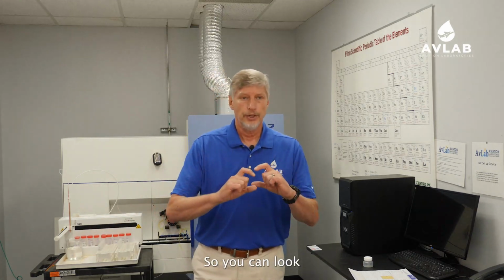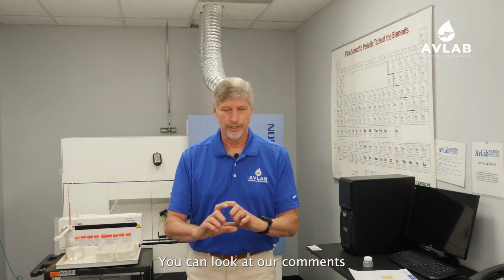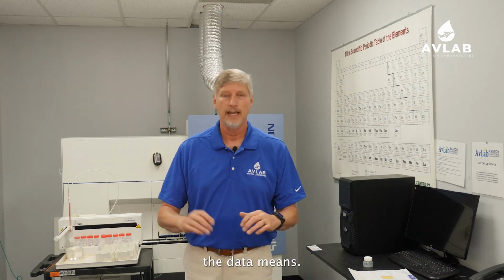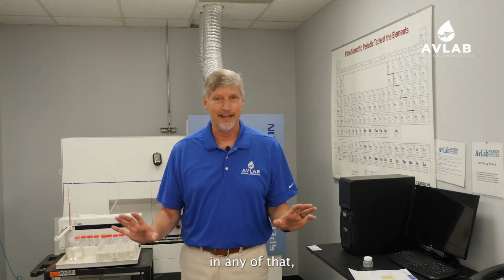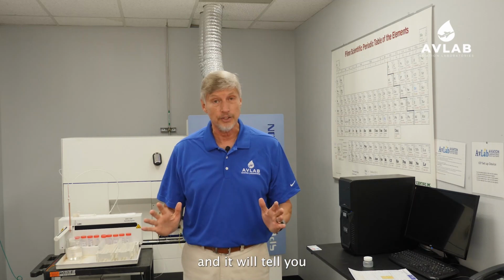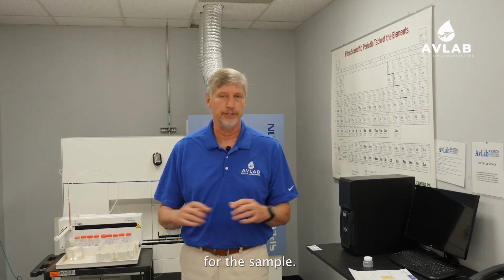So you can look at individual data, you can look at the comparative data, you can look at the trend data, you can look at our comments about the sample and what we think the data means. And if you're not interested in any of that, you can just look at the little stoplight that we have up at the top, green, yellow, or red, and it will tell you whether you need to be concerned about the data that we've received for the sample.